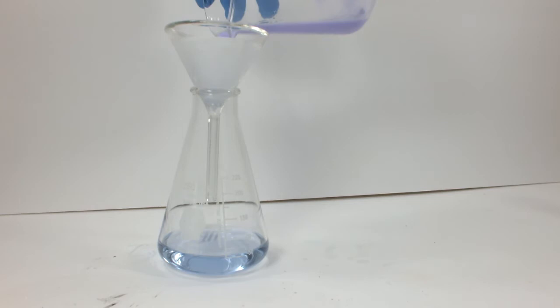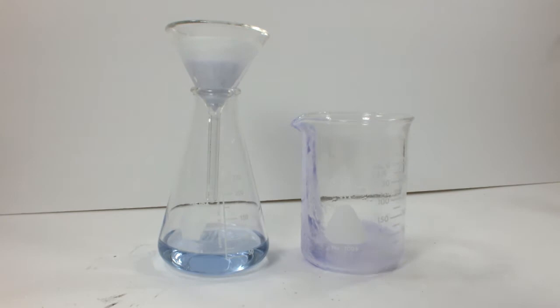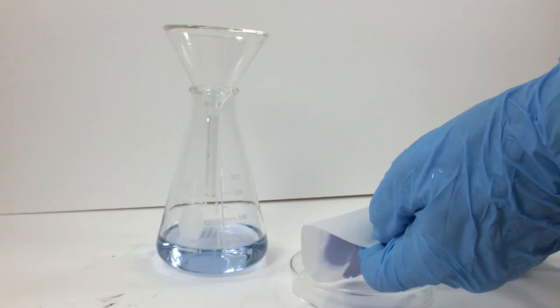And through the magic of editing, here's the last of it being filtered before washing the beaker with more acetone, of course. The color of the liquid is still very apparent, so that's going to constitute a loss. It's fine. I decided it's not worth the extra effort to try and concentrate the solution or evaporate it to try and get that last bit.